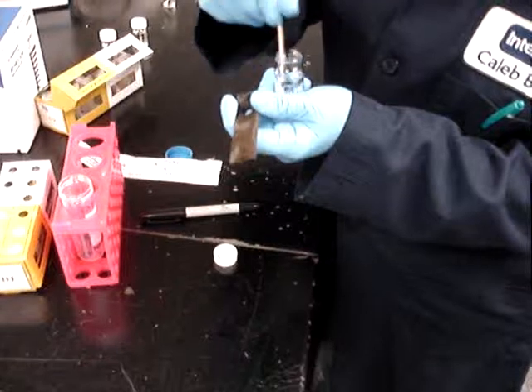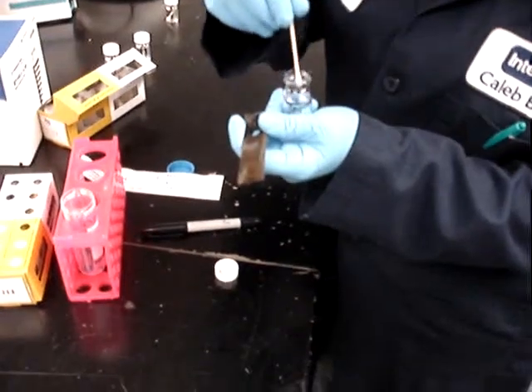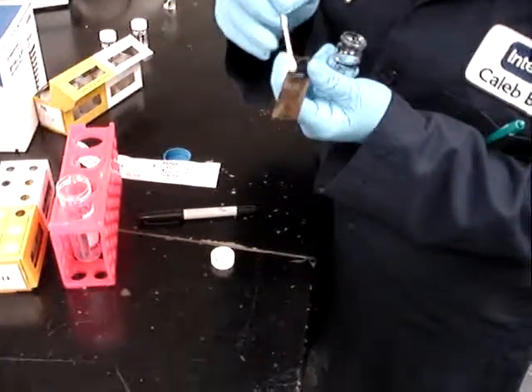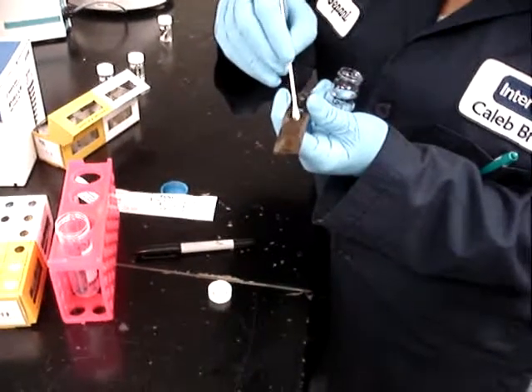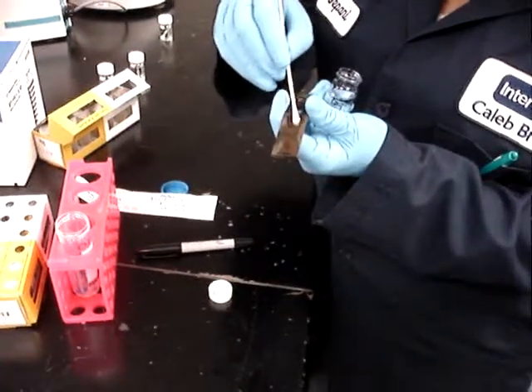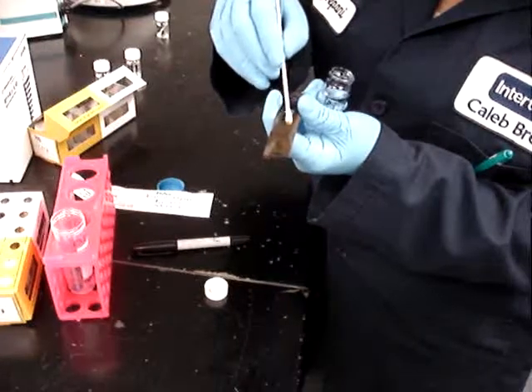Agitation to try to get the material off, but also now the wet swab is applied again to the coupon to obtain even more material from the very same area.